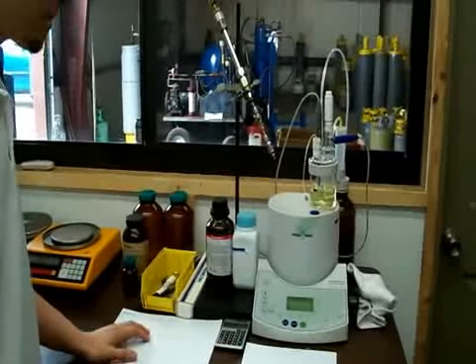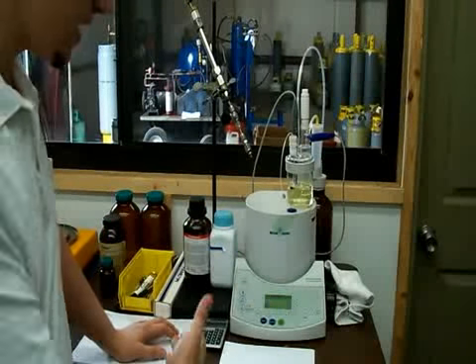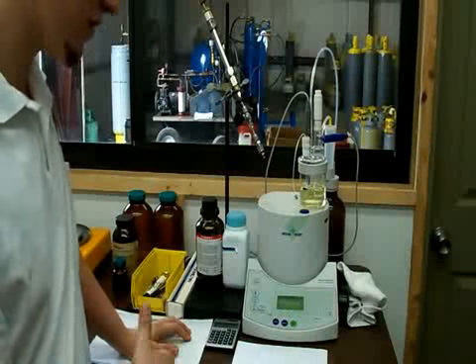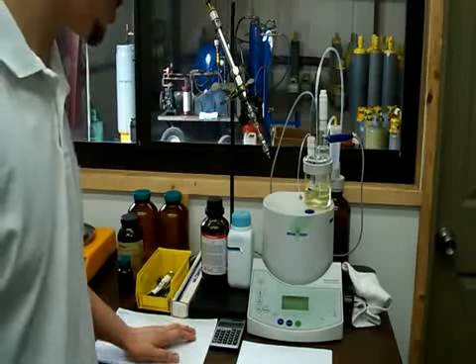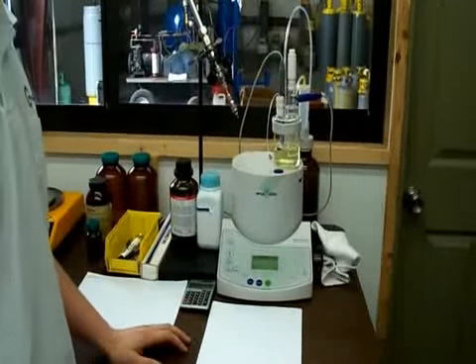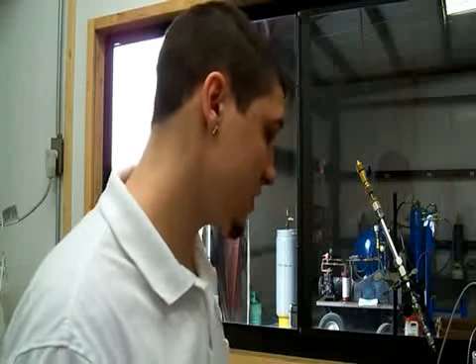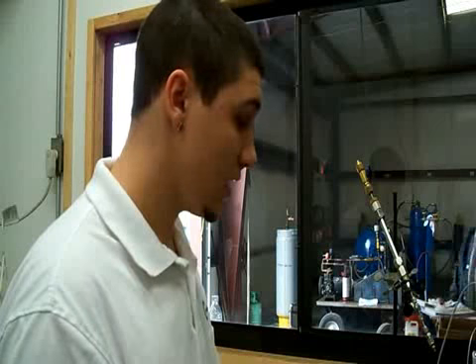What is that piece of equipment that we're looking at right now? This measures the actual water content of anything that's in our shop, or that we have to send out for certification. As I referred back to those 4 points in the certification, this is one of the key parts, because we don't want to have moisture in any of the gas we send out, in any of the chillers or residential systems. So we have a standard of 10 parts per million of water that we have to be under.